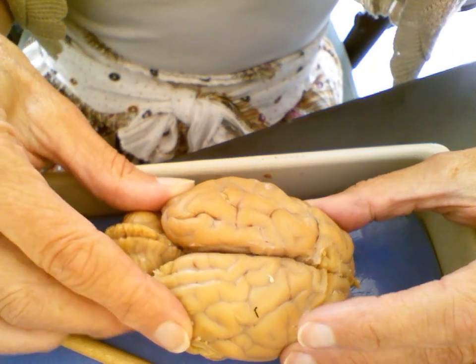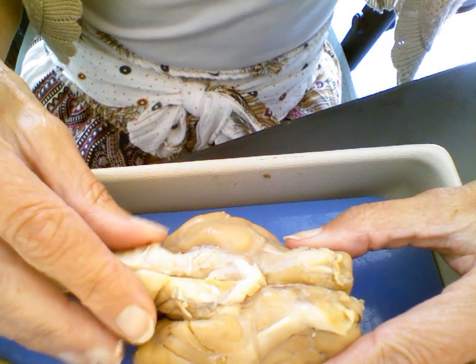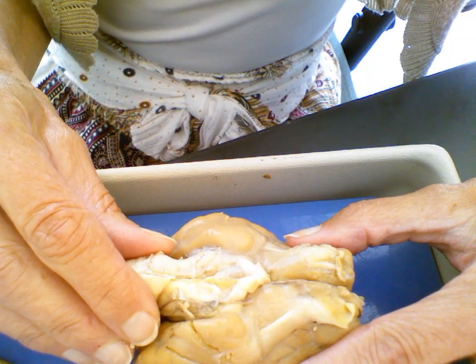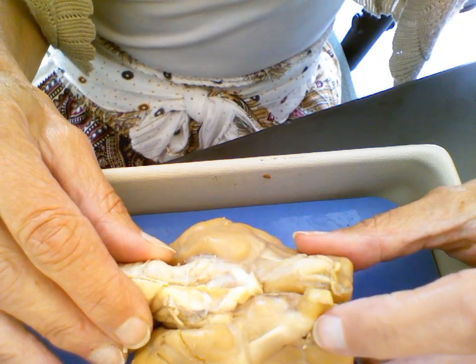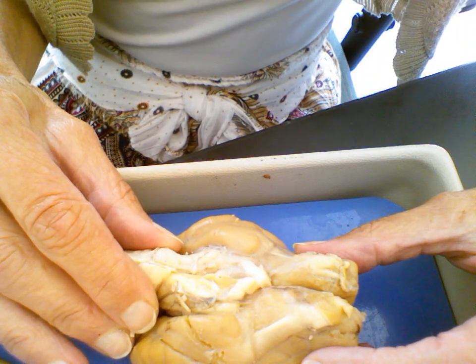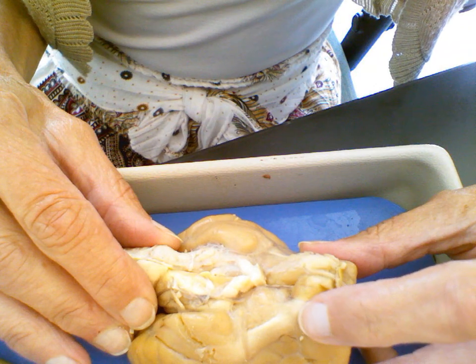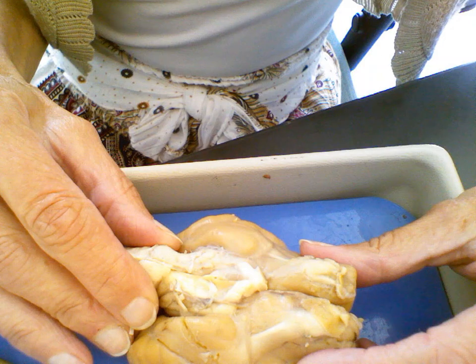Probably one of the more obvious features on the sheep brain, if I turn this over, we're looking at the ventral side of the sheep brain, or we could say this part is inferior to the other side that we just looked at, but ventral's good. And what we see here, where my finger is, is the olfactory bulb, which is the center in the brain for smell, and the sheep have a larger, more prominent olfactory bulb on this inferior or ventral part of the brain.